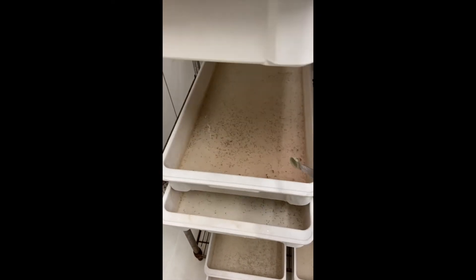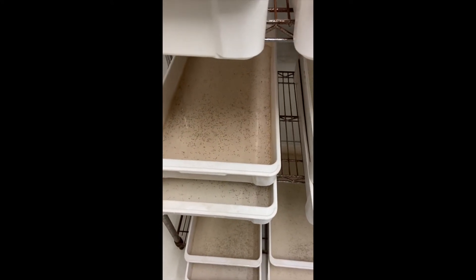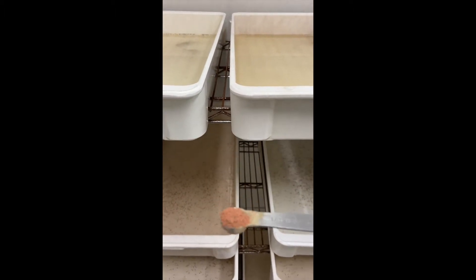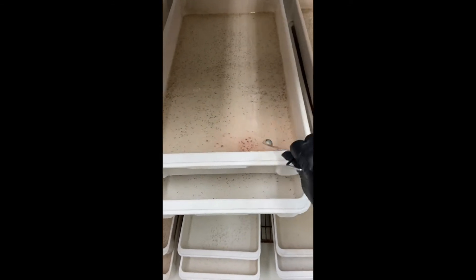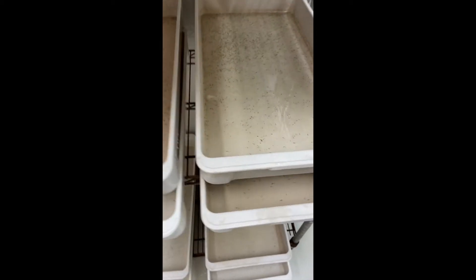Sometimes, if there's a lot of larvae in a tray, I'll do a little bit more than even — like this much. As you can see, that's not quite even, but you don't want to give them much more than that because they just can't handle eating that much. It will stress them, they'll die, and you'll come in the next morning to a bunch of dead larvae. Not ideal.